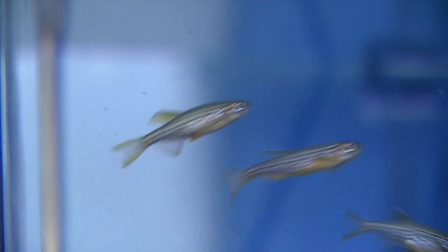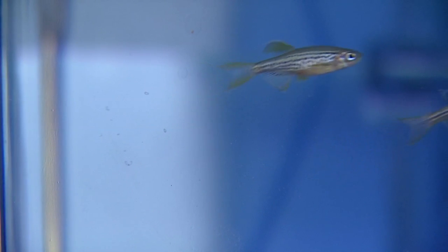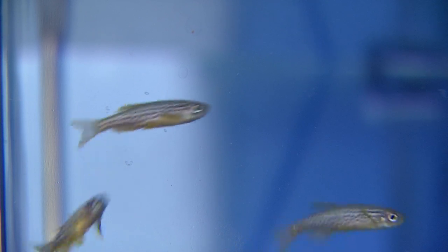So, in this experiment, I have tumor cells growing in culture in a dish. What we do is we take them out of the dish, we put them in solution, and then we inject them directly, intravenously, into circulation in this fish.